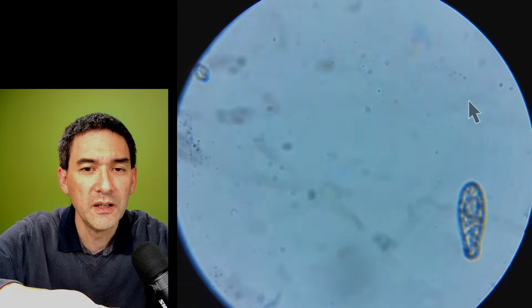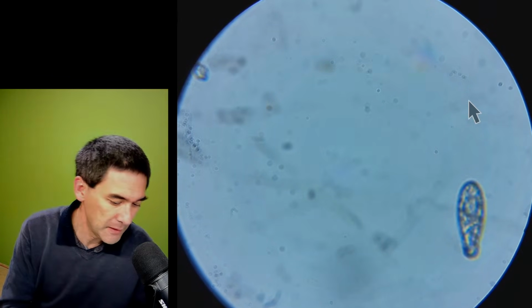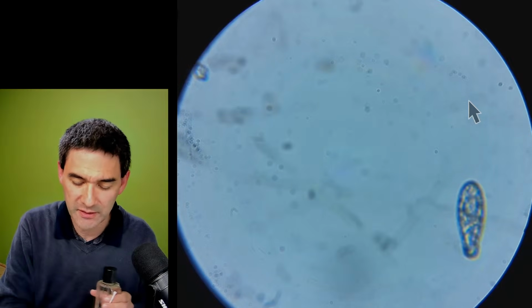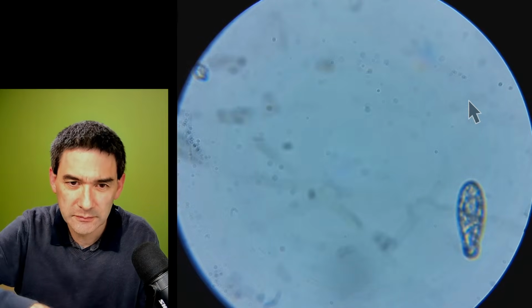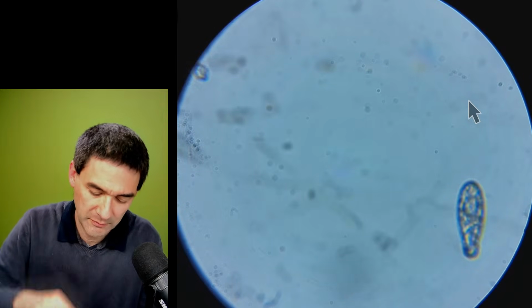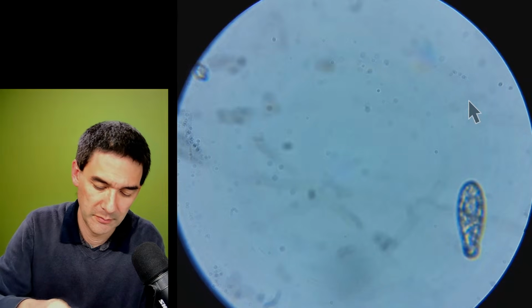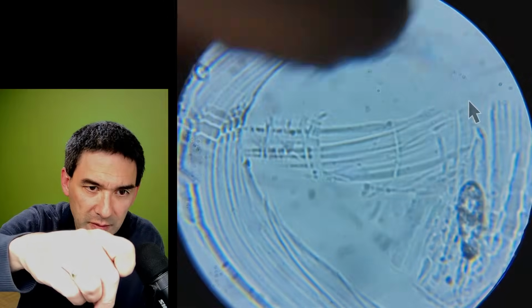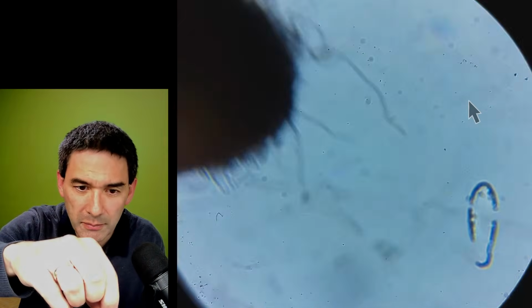Yeah, this weird thing. You know what I'm gonna try? I'm just gonna give it a try. Just a second. I've got a bottle of just plain alcohol here. Let's see if it's on the. Let me try to clean this. Yeah. Oh, look, it's getting better.